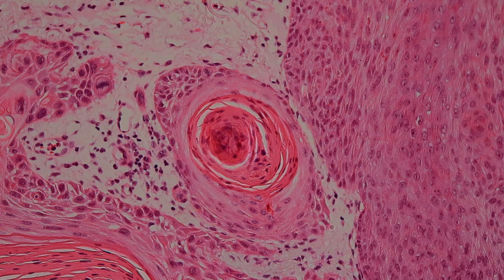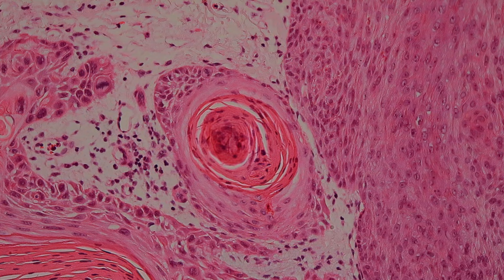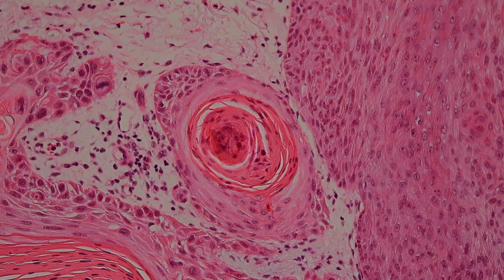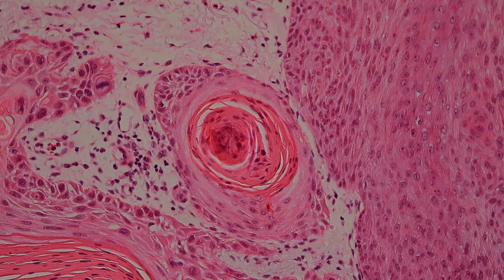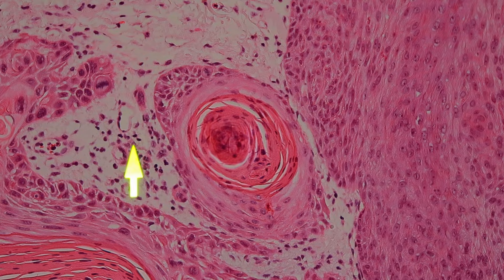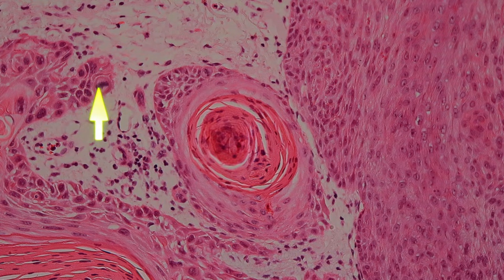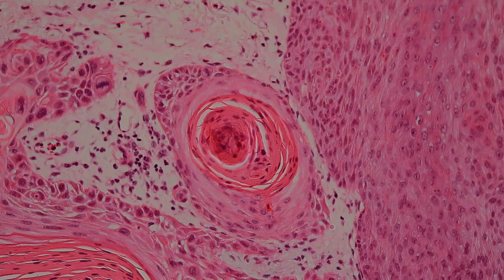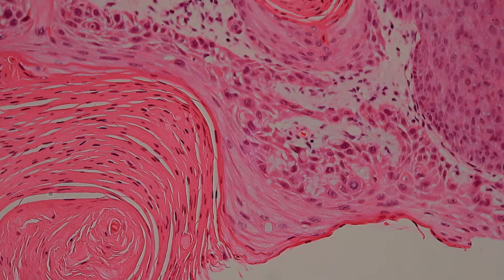A couple of clues: keratin pearls have nuclei in them. The keratin is usually dense and a lot more packed together. Also, usually it's going to be a nest in the dermis. And usually — not always, because sometimes squamous cells can be kind of bland — we're going to see mitoses and atypia around the lesion.